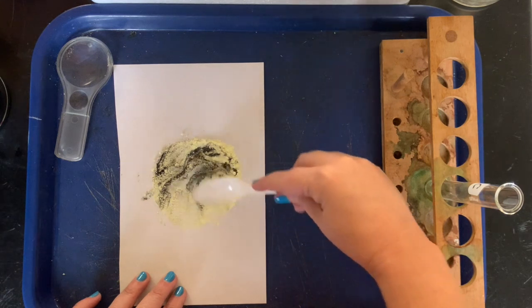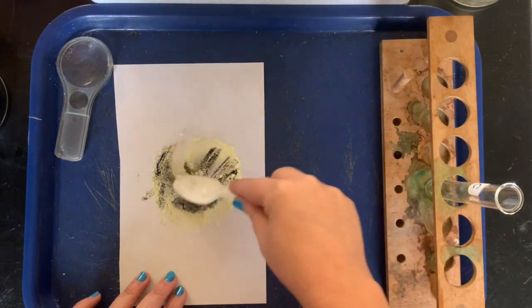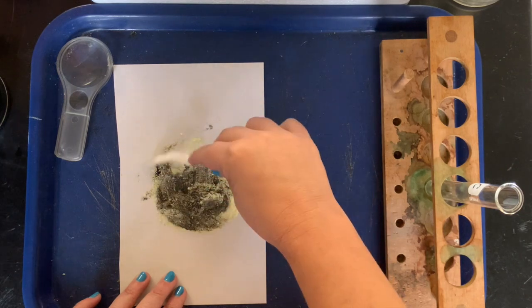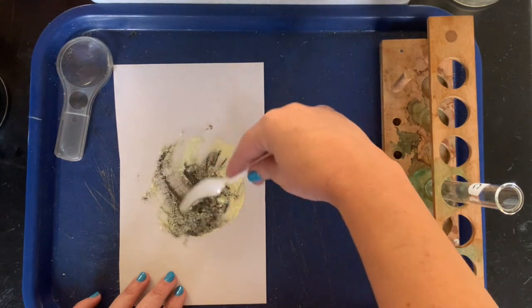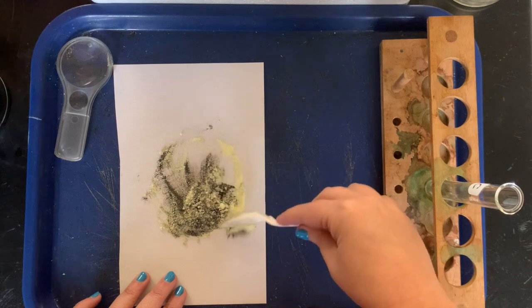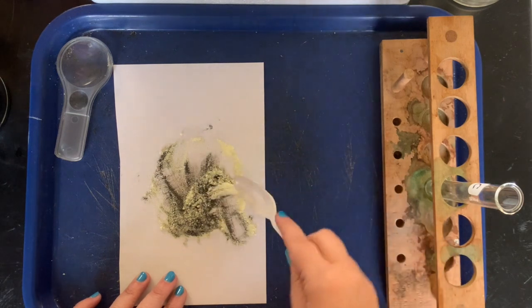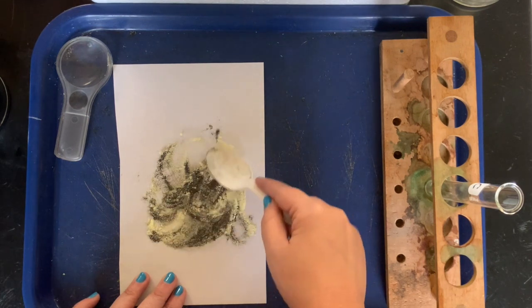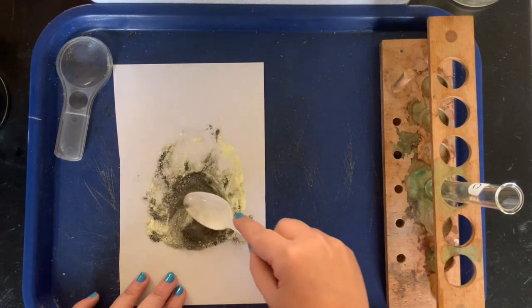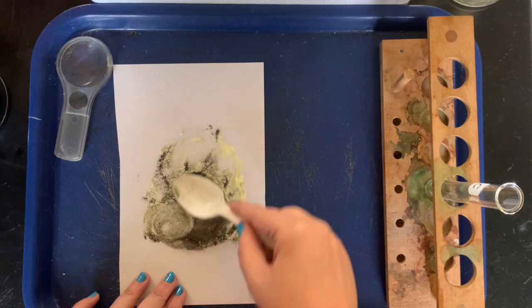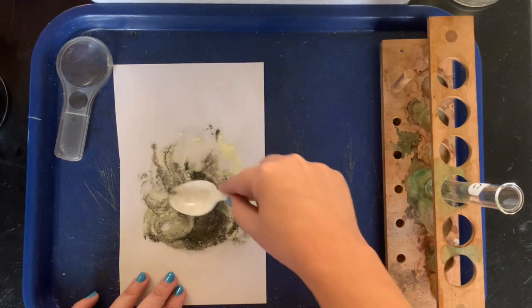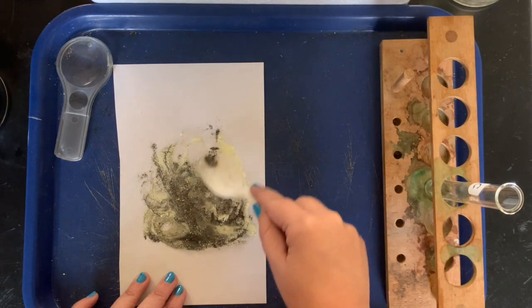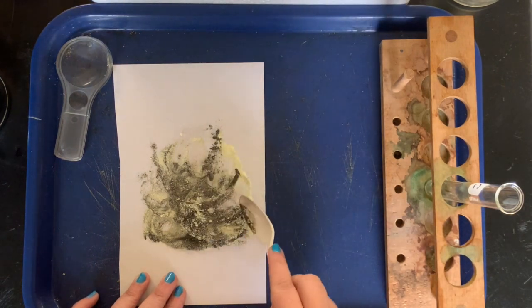So can anybody think, while you're watching this video, think to yourself how we could get the iron separated from the sulfur? I know, Miss Hibbard, I know! Well, I know that iron is magnetic, so I could run the magnet underneath to separate the iron from the sulfur. You're exactly right. So that proves that this is a physical change and we're not making a new substance. We're just, these are just mixed together and we can take them apart.